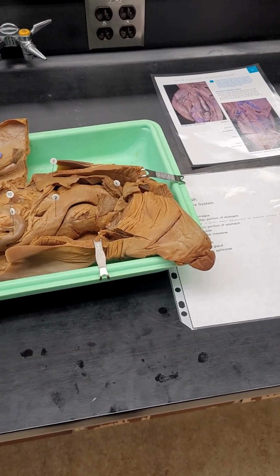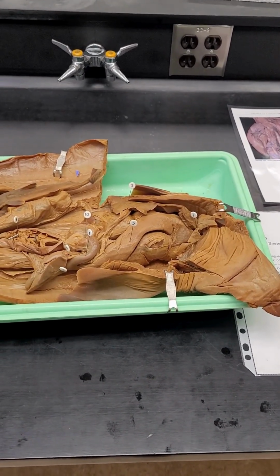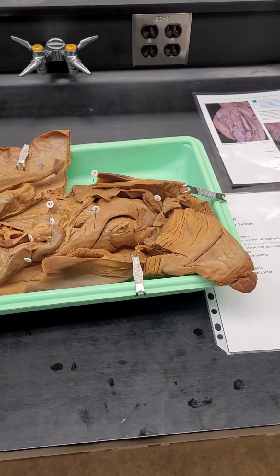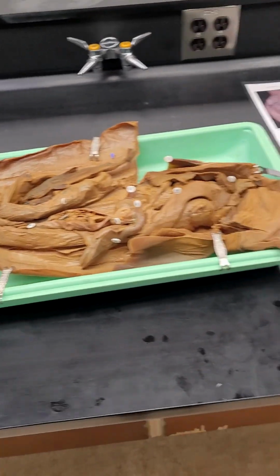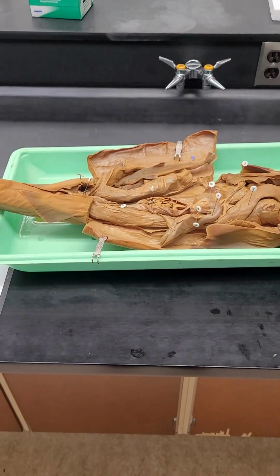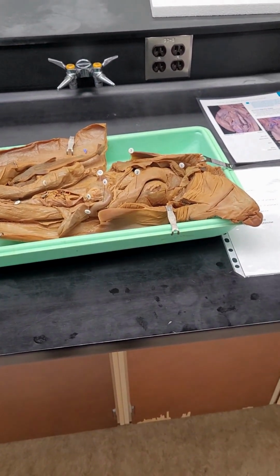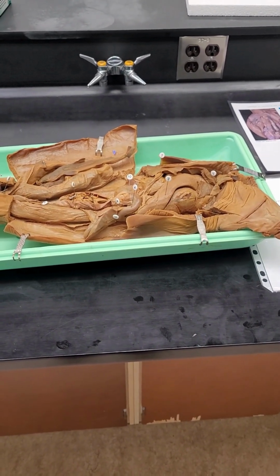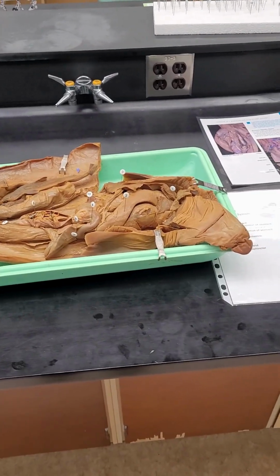With these guys as well, they have spiracles externally, but you can look at my external dogfish anatomy in a separate video, which I'll make, along with the detailed internal anatomy, because this specimen is rather aged, so it's better to use a new one. So the emphasis will be on the differentiation of the digestive tract as they now gain a higher degree of specialization to increase efficiency.